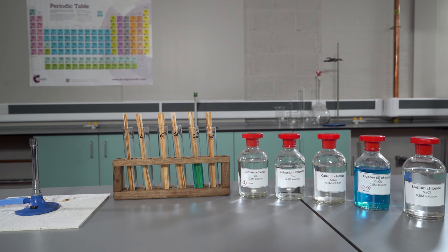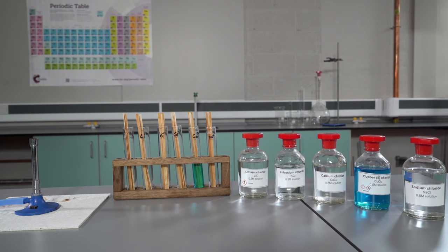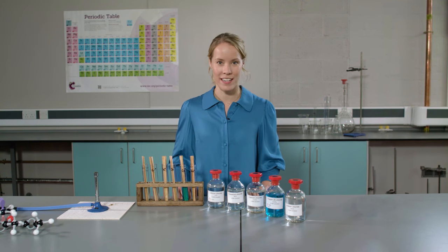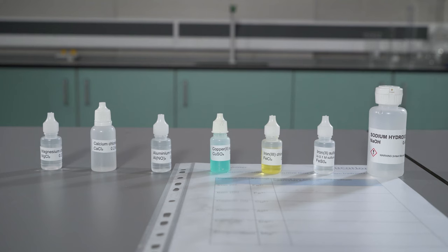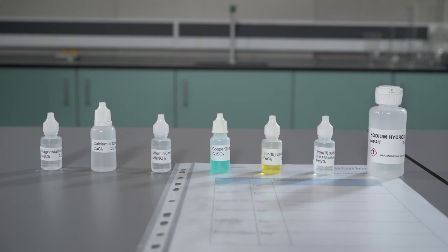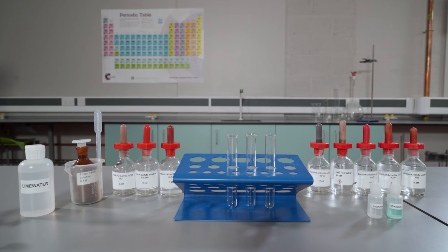The first experiment is a flame test, used to identify metal ions. We're going to see some bright colors here, so this is visually exciting. The second test uses sodium hydroxide to identify positive ions. And finally, we'll do a group of experiments to identify negative ions, including carbonates, sulfates and halides.